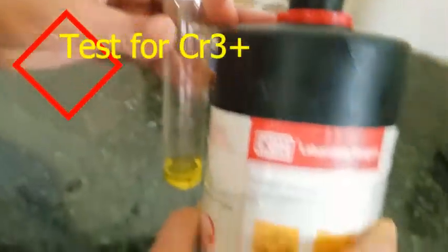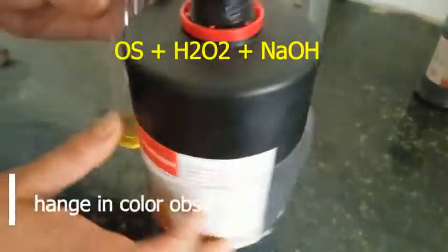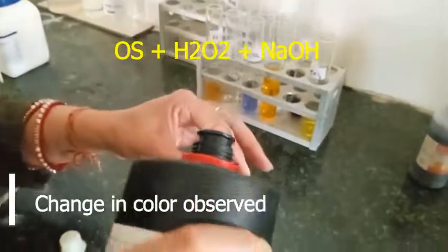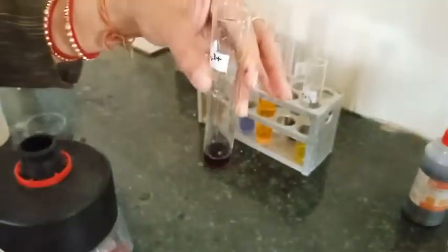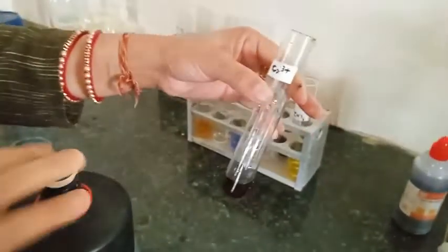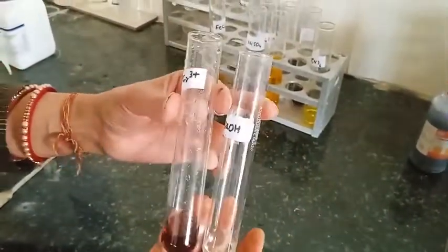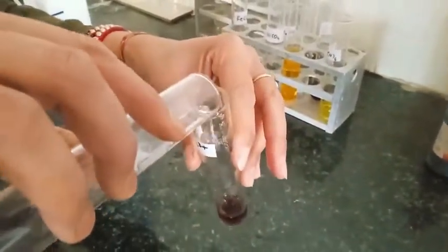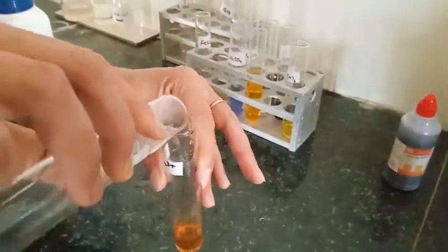Now test for chromium ion, which is again of the third group. To this chromium 3+ solution, we are adding hydrogen peroxide first, which changes its colour, and then sodium hydroxide (NaOH) solution, which changes its colour again. This confirms the chromium ion.